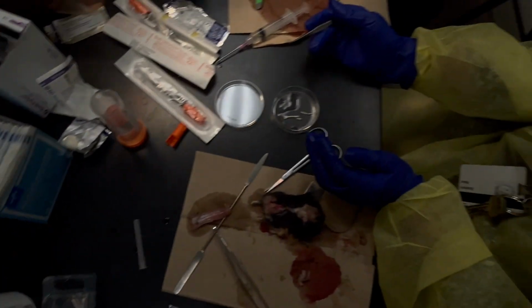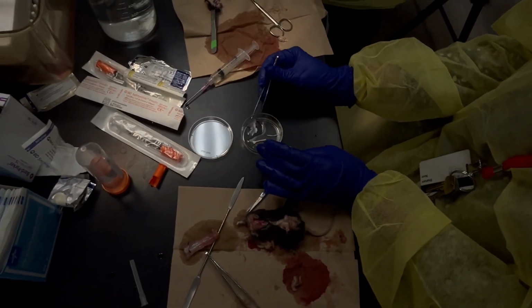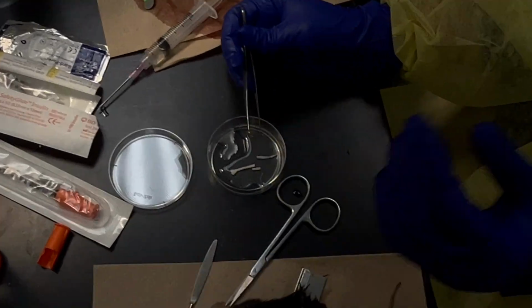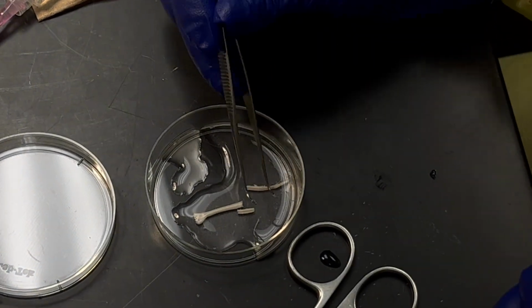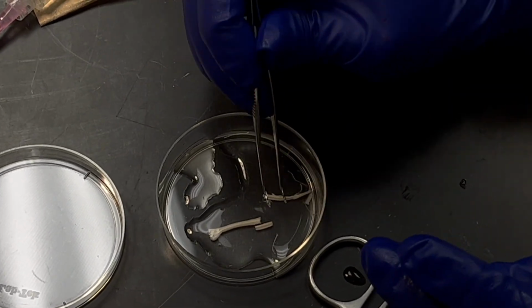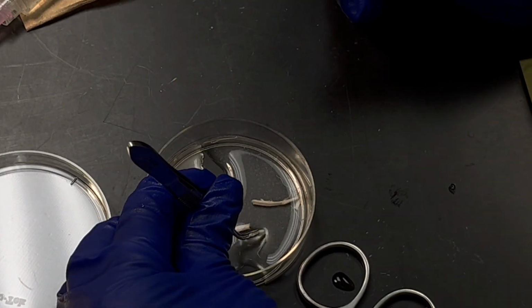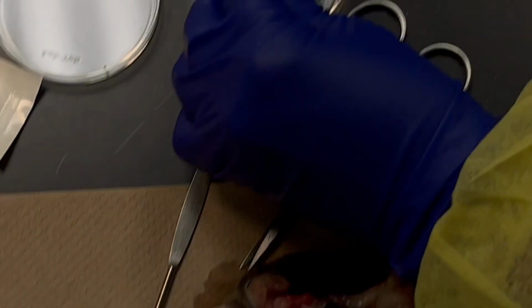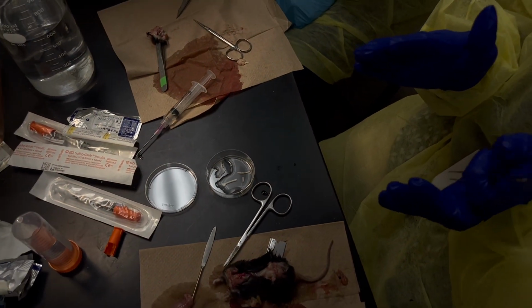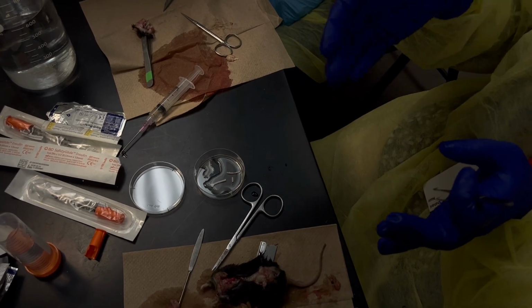For culture study, when I'm doing this, I usually take the whole lumbar spinal cord because there hasn't been any CCI. So I would simply collect this much tissue. But for the RNA work, I will cut in here, keep the tissue like this, and then simply put it in there. And what happens is it's actually super hard to collect all four at the same time because things get frozen.